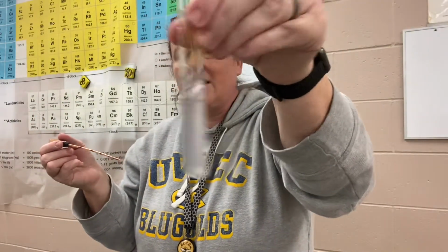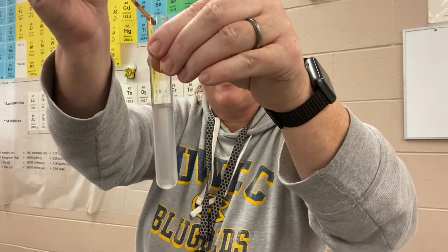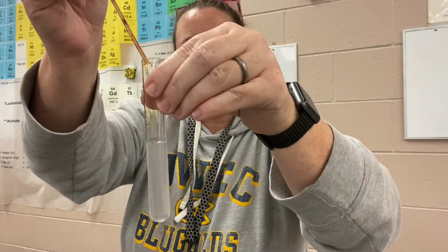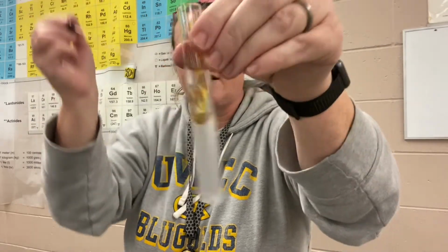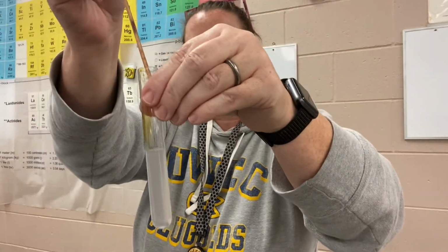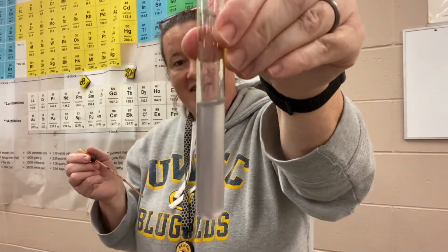Oh, it's really, really close. Now it looks like just the slightest of a purplish tinge. I'm gonna put one little drop. One little drop in a titration can be what reaches the end point, and that's going to be the point that causes a permanent color change. And it is really, really close. And I am still surprised. It is still reacting.